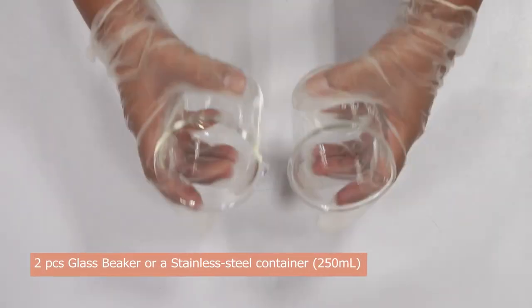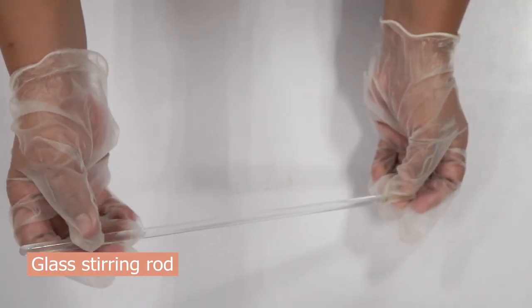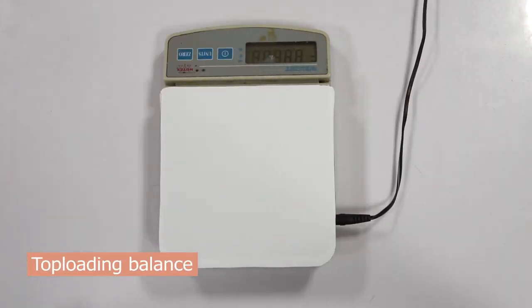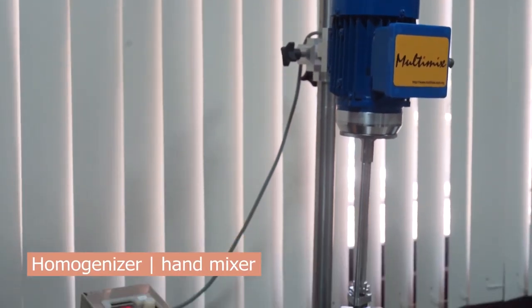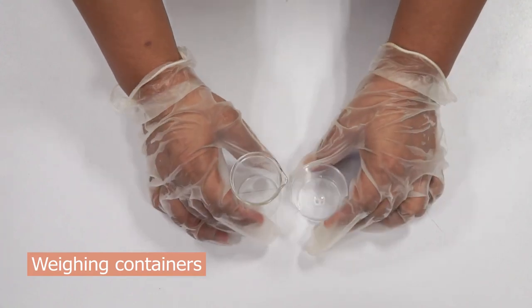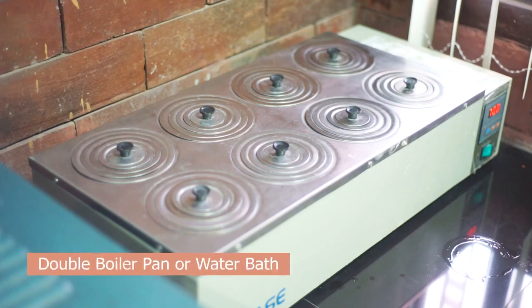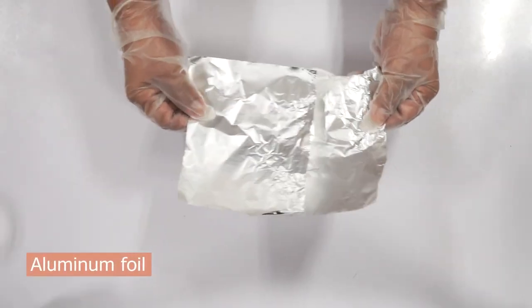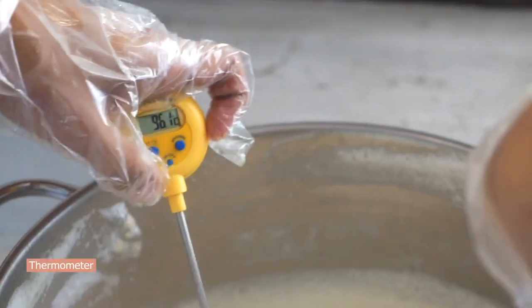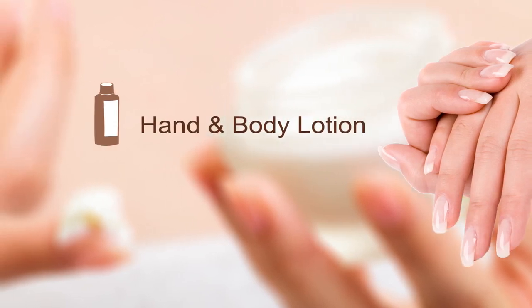You will need a glass beaker, stirring rod, top loading balance, homogenizer or hand mixer with dough hooks, weighing container, graduated cylinder, double boiler pan, aluminum foil, tissue paper, product containers, thermometer, and stove.